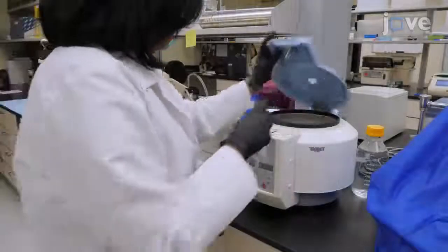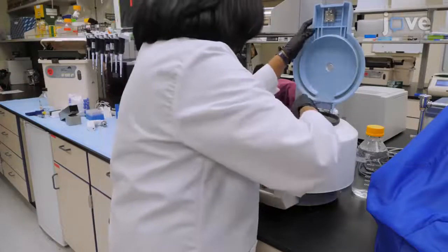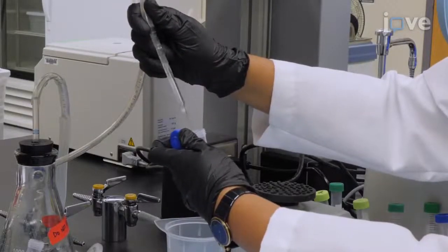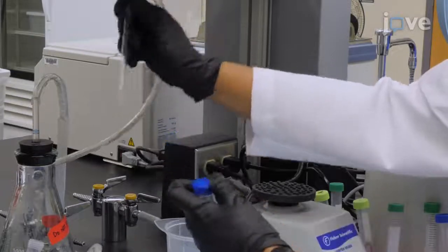Spin these tubes down for three minutes at 6,180 g. Following centrifugation, aspirate out the M9 buffer, retaining just the animal and egg pellet.